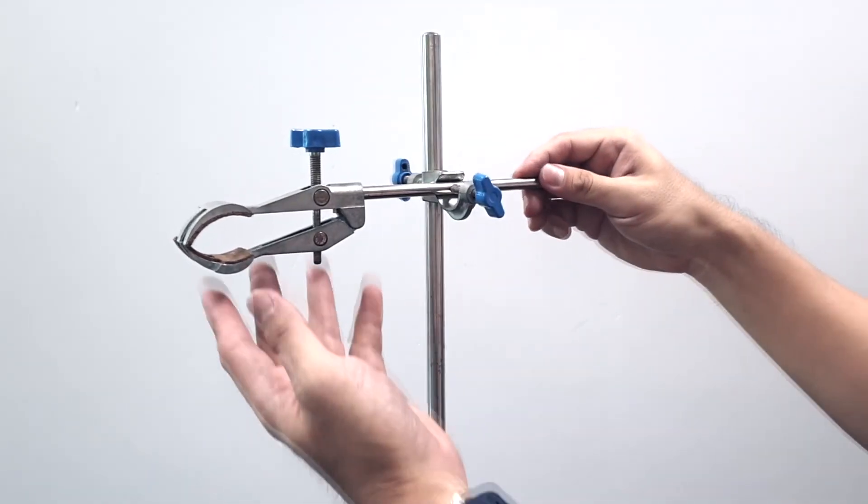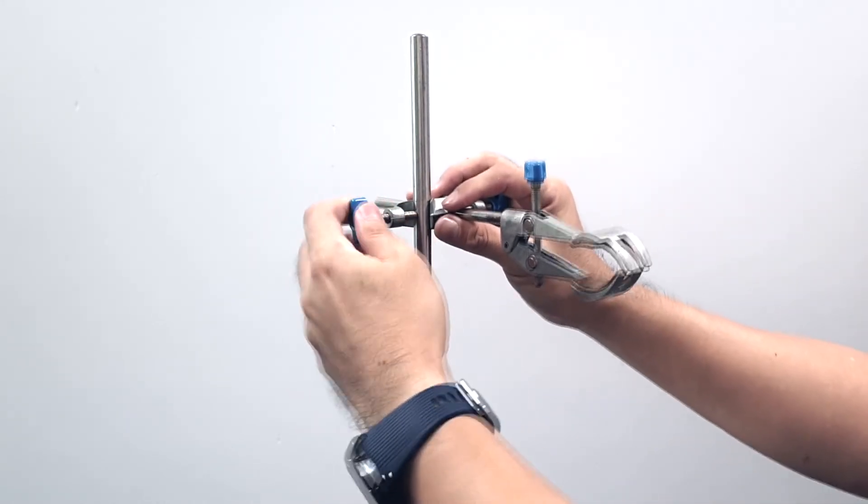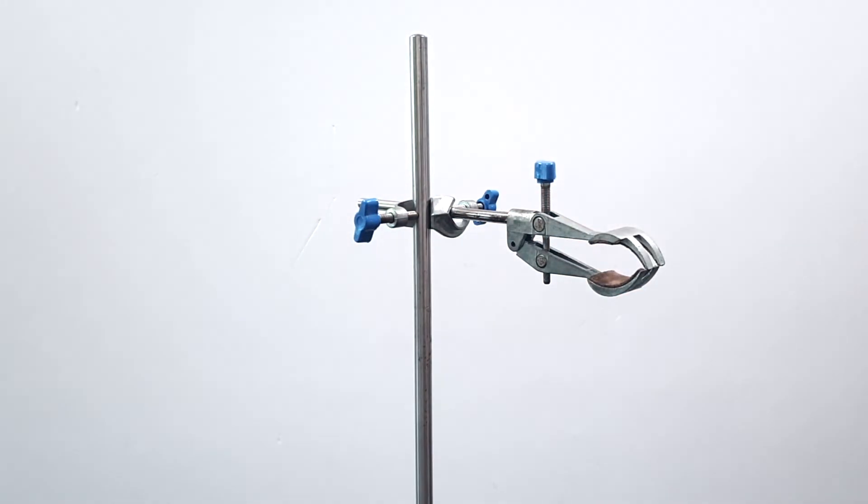And lastly, the side knob at the boss here allows you to adjust the height of the clamp.